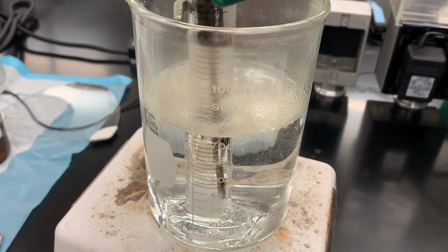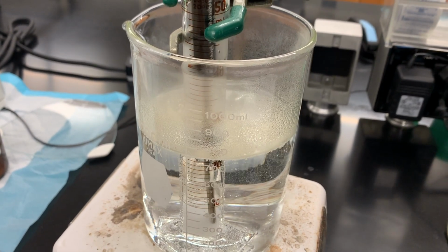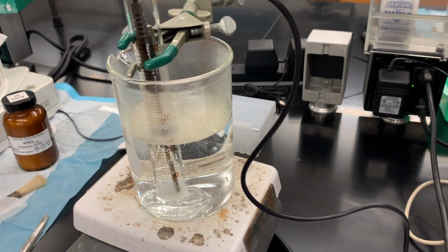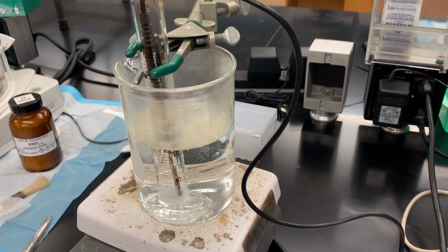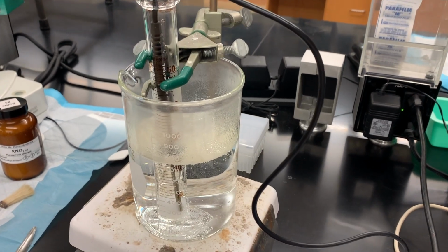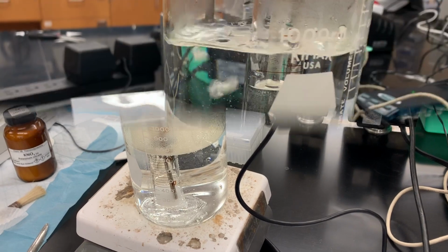of the hot water bath, and essentially I want to get the temperature at which it crystallizes, and that's right when our solubility occurs. Right when we start to see crystals is when we have the solubility of potassium nitrate at a given temperature. Okay, so we'll check back in on that in a minute.